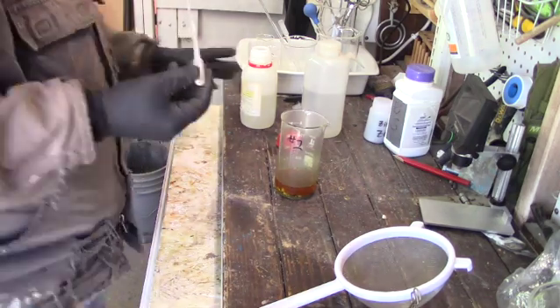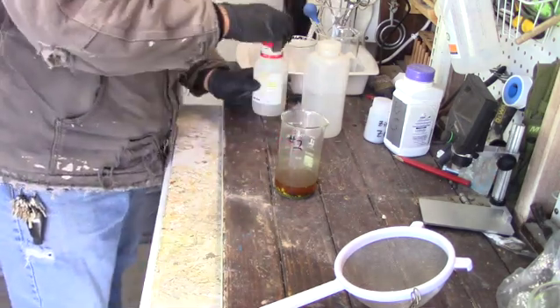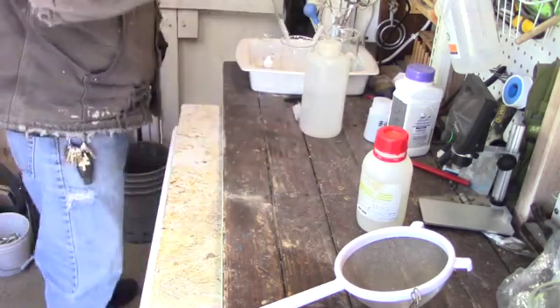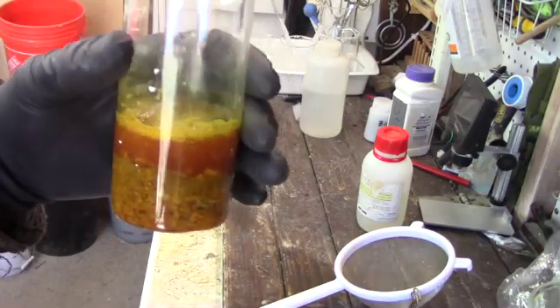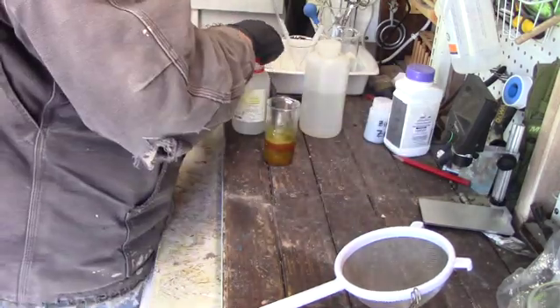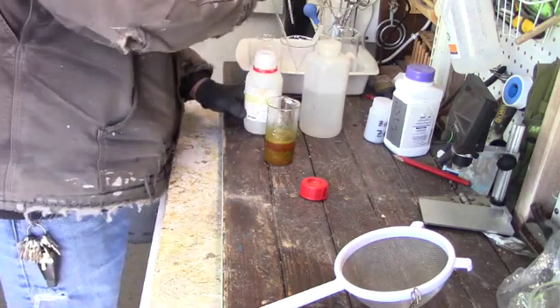Well, it's been long enough, so we're going to add our nitric acid, creating our aqua regia, which will dissolve our gold — hopefully put it into solution so we'll be able to test and recover it. Putting in about two milliliters of nitric acid. This is concentrated nitric acid, so you don't need a lot. If you use a lot of nitric acid, then you're going to need a lot of sulfamic acid or urea to de-nox your solution before trying to precipitate. So we're going to add our nitric to this, set it back on the heat, and let the nitric do its thing.